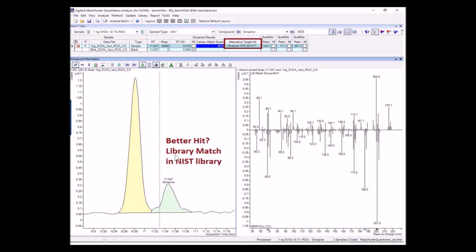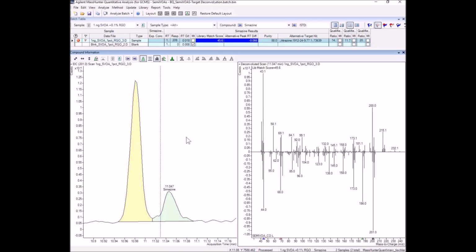So the question of an alternative hit, a better match score coming from an entry in the NIST library, that information is stored in a column called alternative target hit. And you can see I've added that column here, and we'll explore that in terms of the report that is part of this workflow.